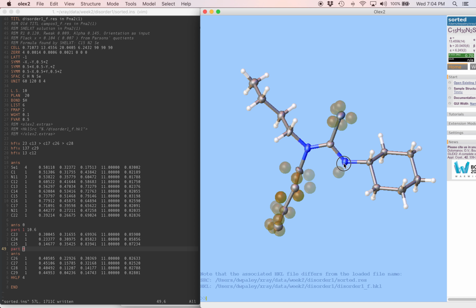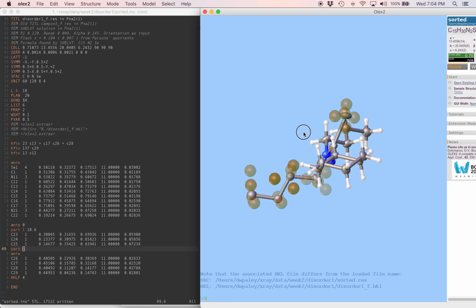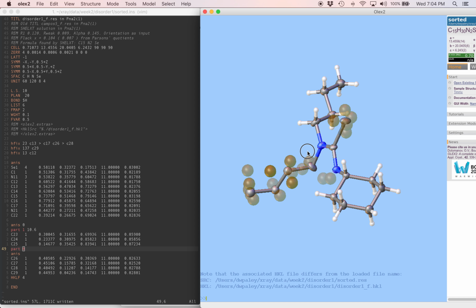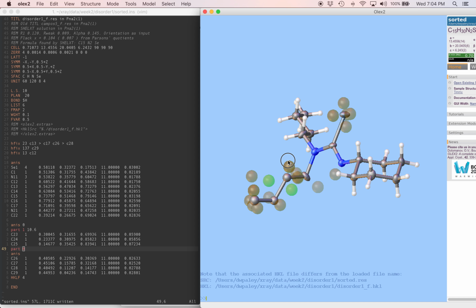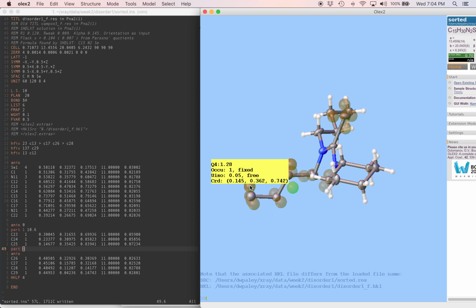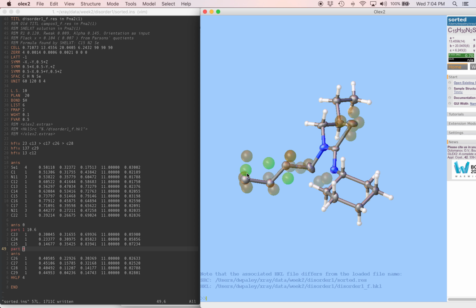We can see all the ordered carbons have their hydrogen atoms in place now, so that's a good sign. We can see some stronger difference features around the disordered part of the molecule now. This was already here. This is new, and it looks like it's in a reasonable place that it could be part of the second position of this chain. Finally, this one, just kind of following a potential zigzagging conformation of the second chain. We can guess that maybe this is the second position of the terminal methyl group.